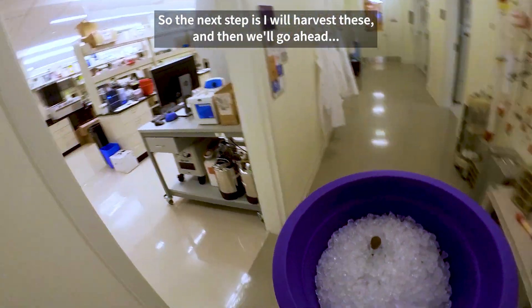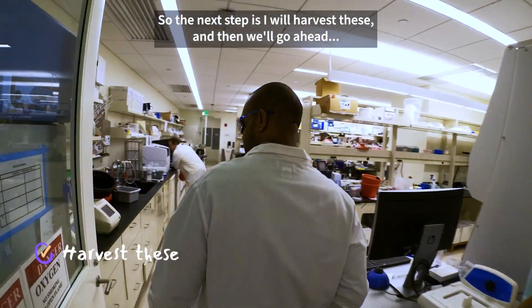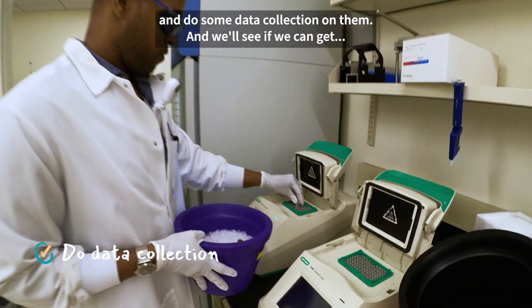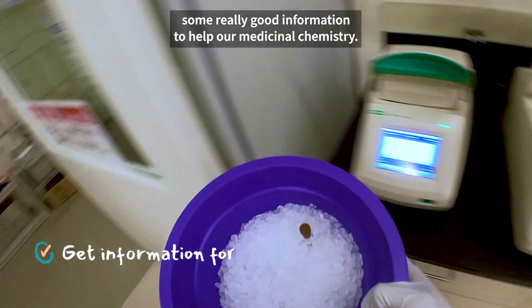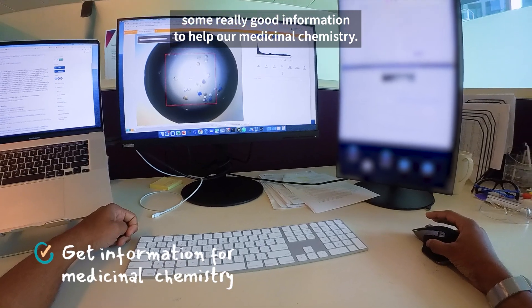The next step is I will harvest these and then go ahead and do some data collection on them, and we'll see if we can get some really good information to help our medicinal chemistry team.